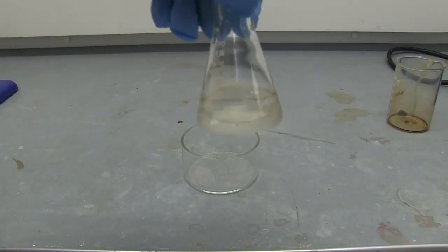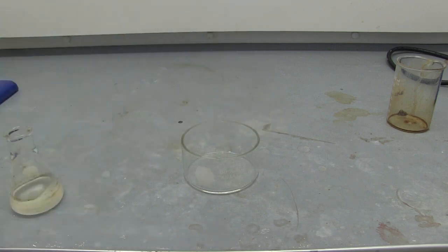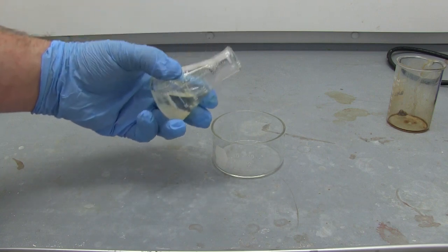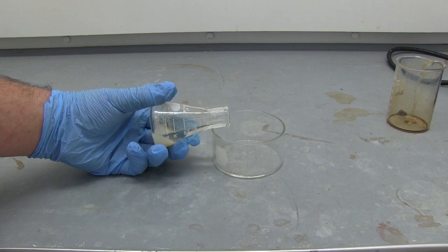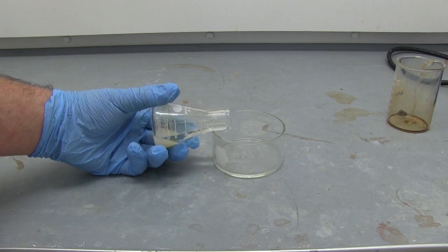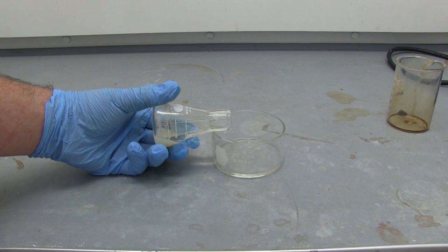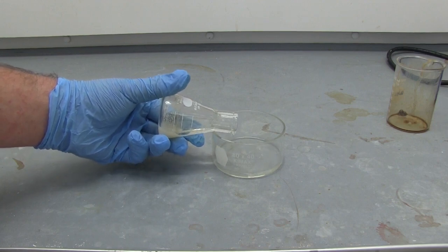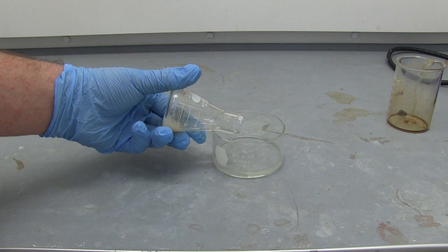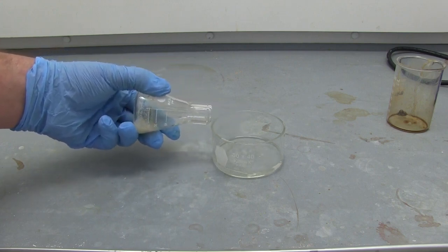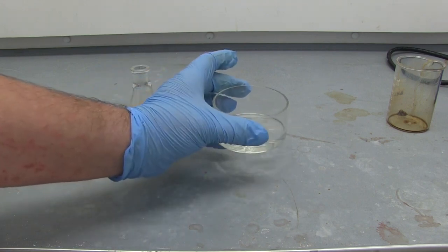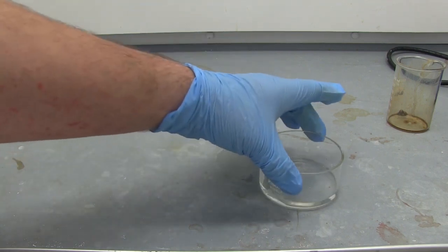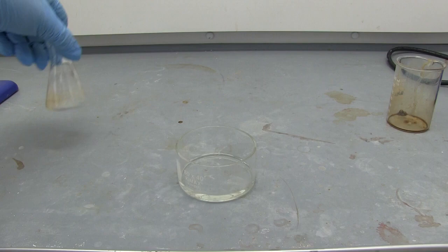Now that we have our dichloromethane extracts we're going to dry with some anhydrous sodium sulfate and put it in a crystallization dish to get our crude caffeine. Now we will have to evaporate and get our crude caffeine.